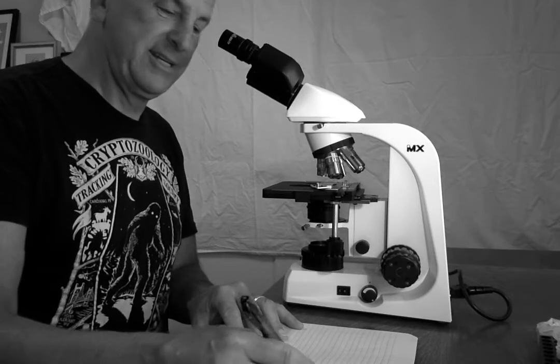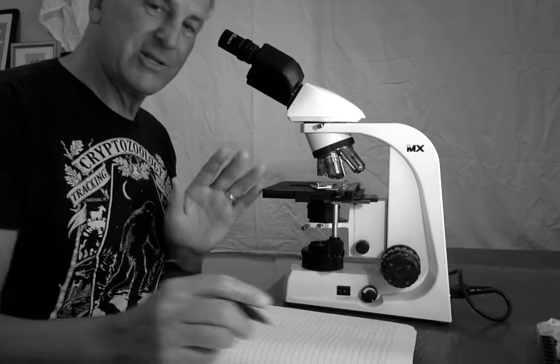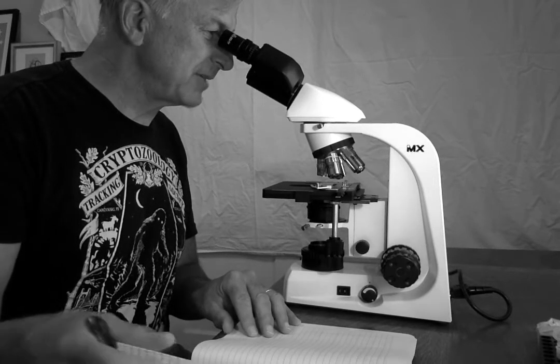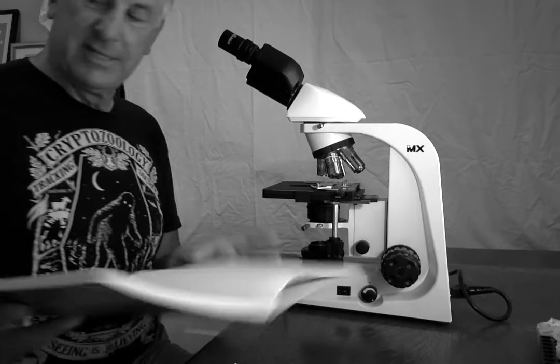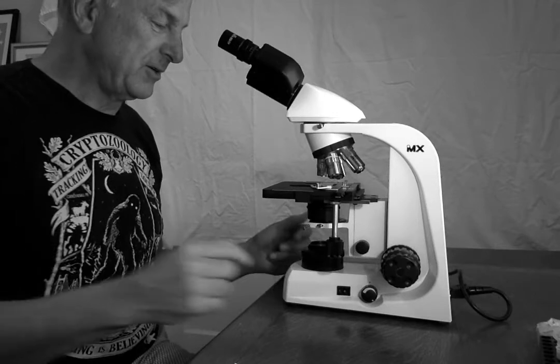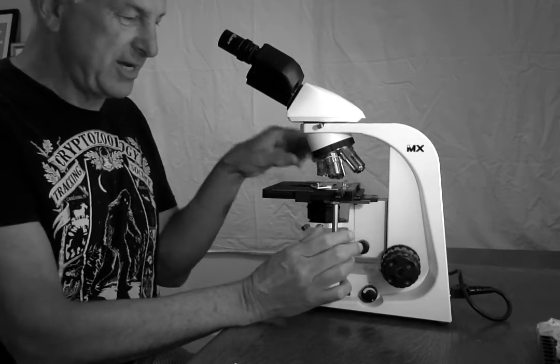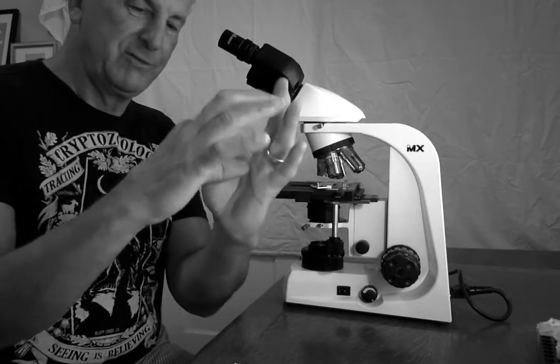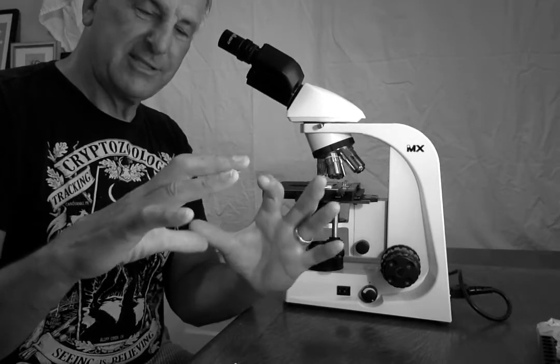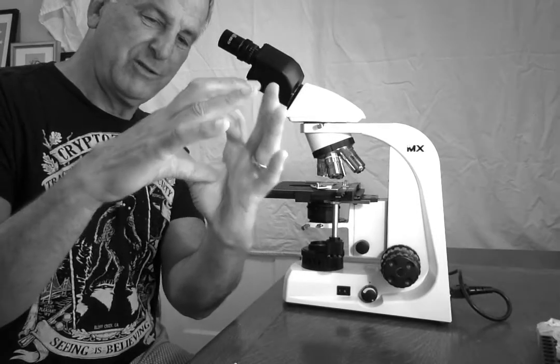And I tend to draw a little, look, draw a little, look, draw a little, and see if my drawing is matching what I'm seeing. I usually draw a circle to represent my field of view and make a sketch of what I'm seeing. All right, so notebook handy while observing. I'm in focus. I found something neat. I've centered it in my field of view because when I go to the next objective, my field of view is going to shrink. So if there's something I want to see, I want it in the center, so when I get to a smaller field of view, it's still in the center.